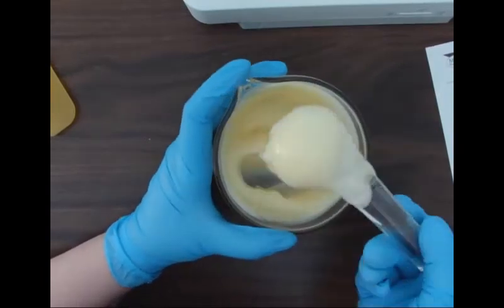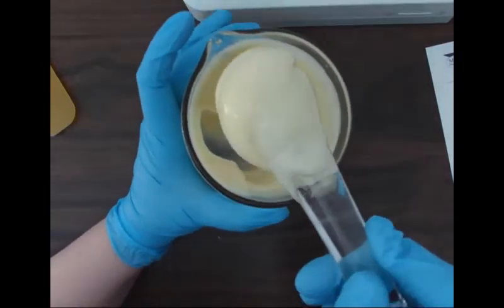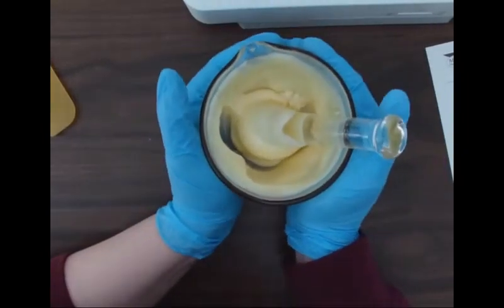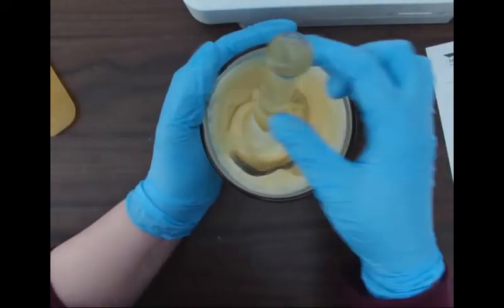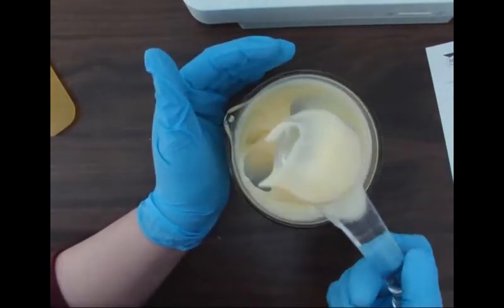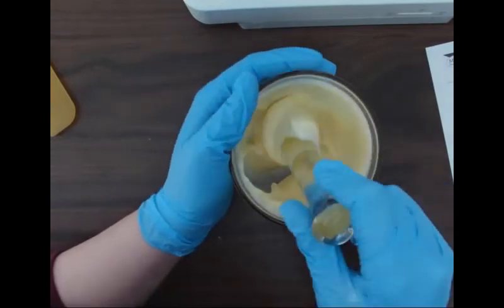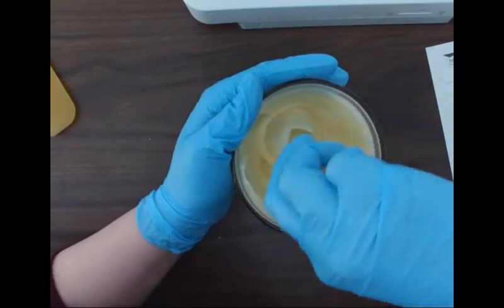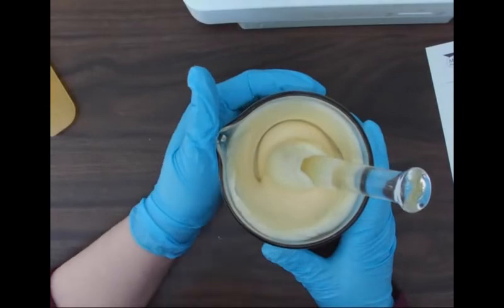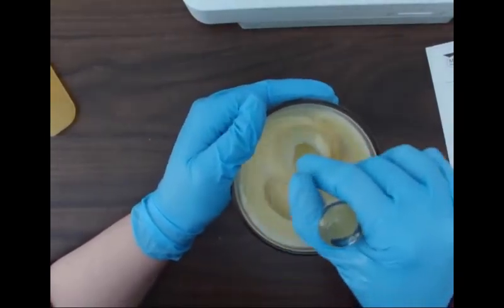So I did a little bit of a hyperlapse there, but you can see right at the end, it goes into a thicker paste. It's still quite cool at this point. Like when I'm touching it there with my hands, I can feel that the compound is still kind of cold. So as it comes to room temperature, it will solidify even more than it already is. Just because that part B, when it gets to room temperature, the chemical properties are going to change a little bit more. But that's basically that reaction between the part A and the part B of the PLO kit. It's going to come together and make a gel.